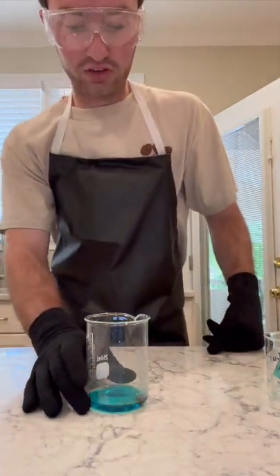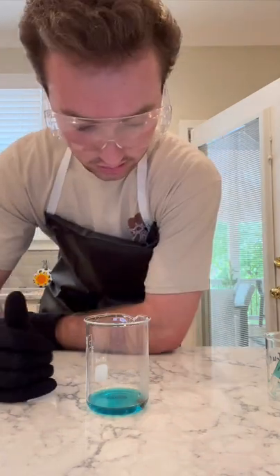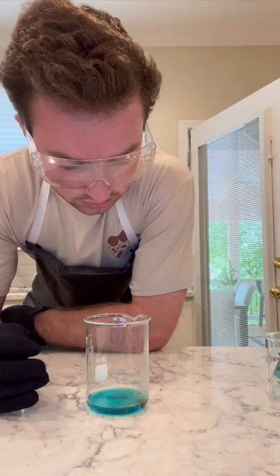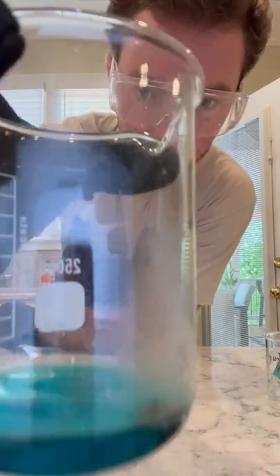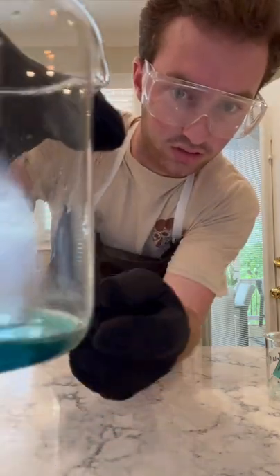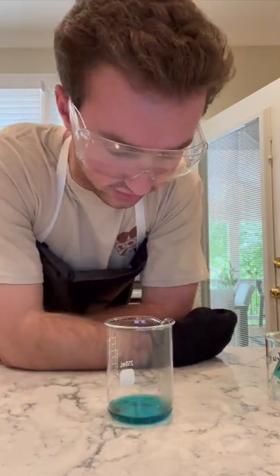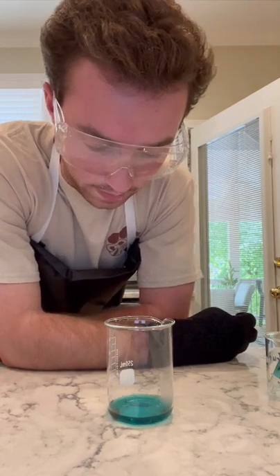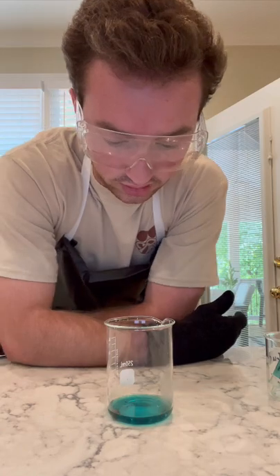The aluminum foil is actually completely changing color. I'm not sure if you can really tell. I'm gonna wait a little bit to let the reaction fully complete. But it's a completely different color, as you can tell. Actually, I don't think you can. Where'd it go? Oh yeah, you can see it's in the bag right there. It's kind of a brownish, rustic color now. If it moves at all, it's kind of falling apart. Obviously it's a completely different substance now.